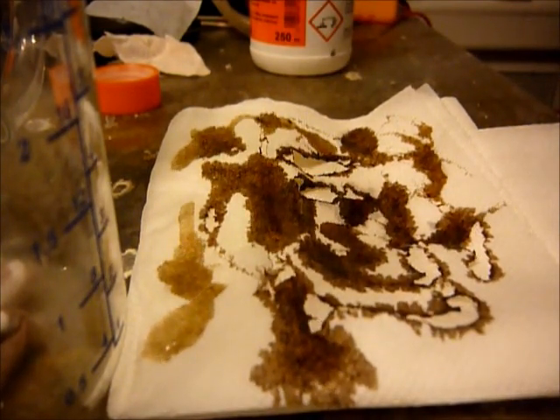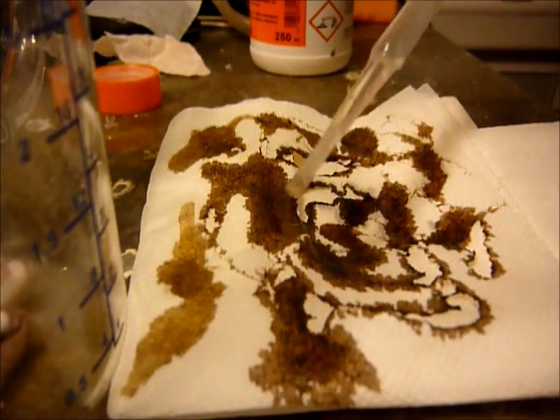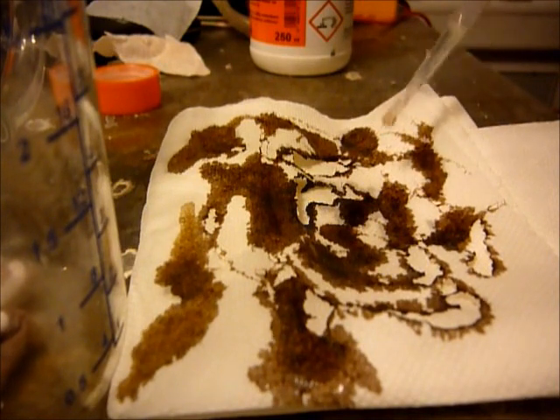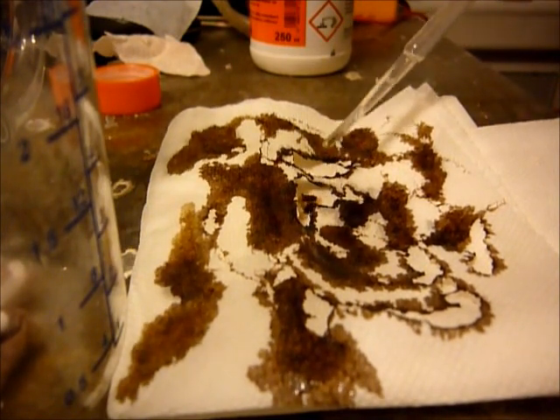So you must not enter in contact with sulfuric acid, because then you will be etched and the same thing which happened with the paper now will happen with your body too.